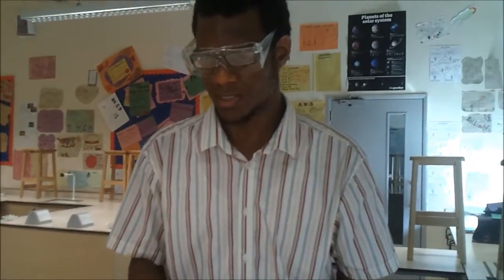Hi, my name is Mr Al Aremi and I'm a scientist. We are going to do an experiment to prove that carbon dioxide is actually given off in the chemical decomposition of calcium carbonate.